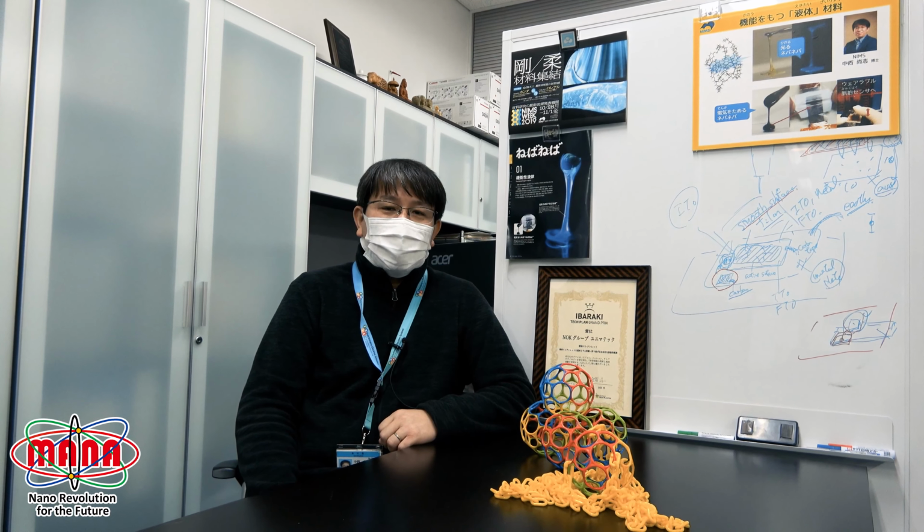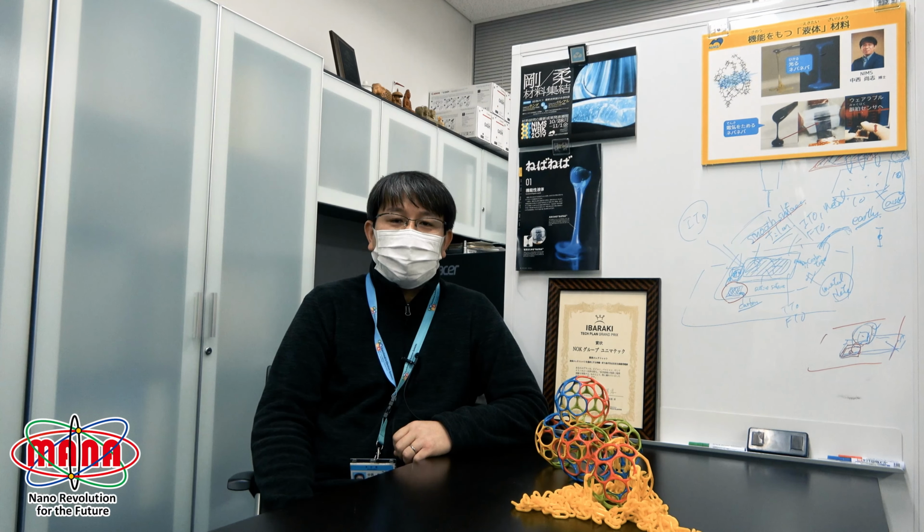Our research is in the field of polymer and organic molecules, soft systems, where we design and synthesize molecules which have optical and electronic functions. From now, you can visit our lab, see how we synthesize the molecules, investigate the molecules, and analyze them as a sensor system. You can enjoy our lab tour.